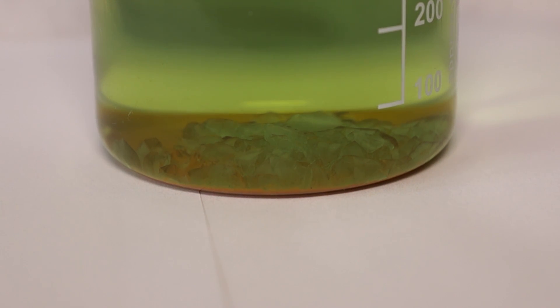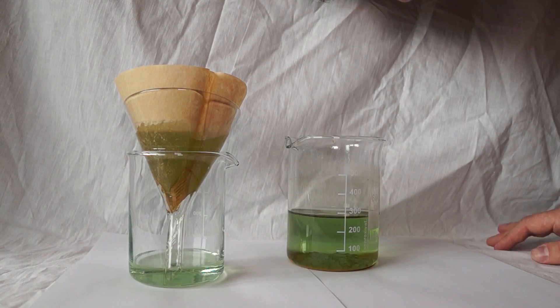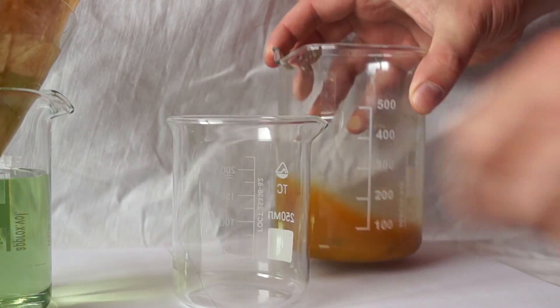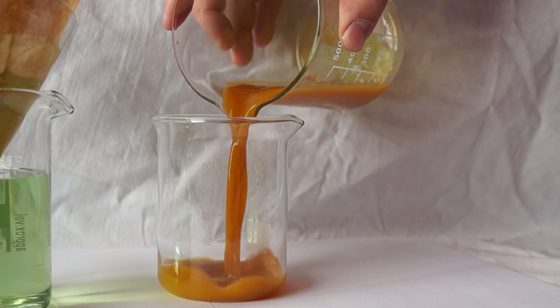Take a filter and filter the solution into another container. However, no need to filter the small amount of solution that contains unnecessary iron oxides. It's better to pour out this residue.